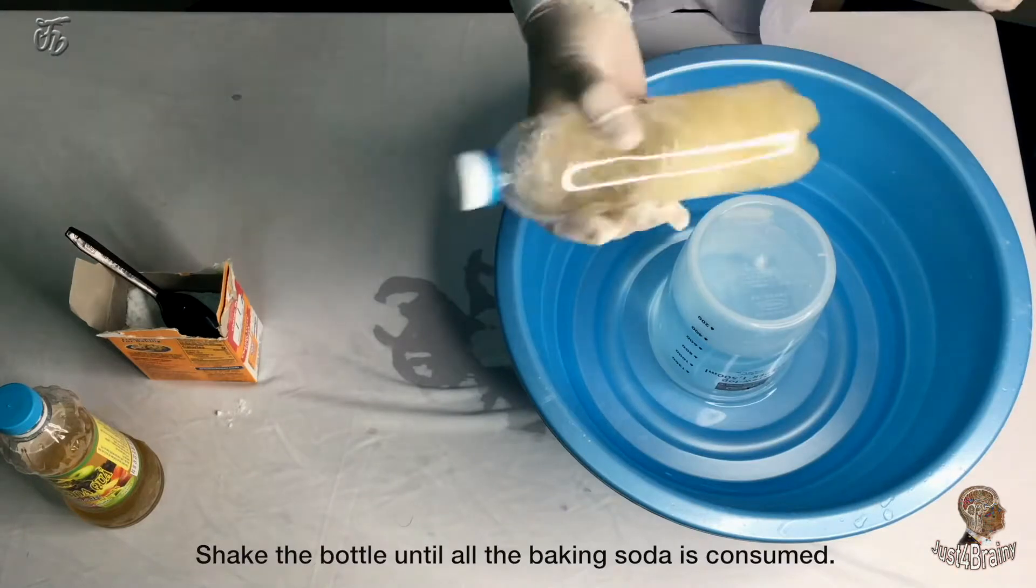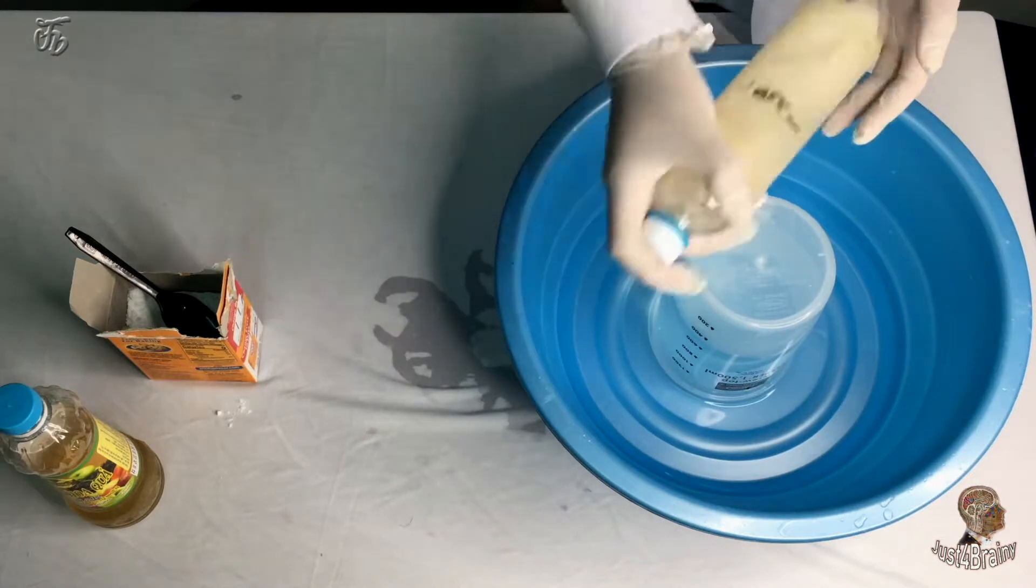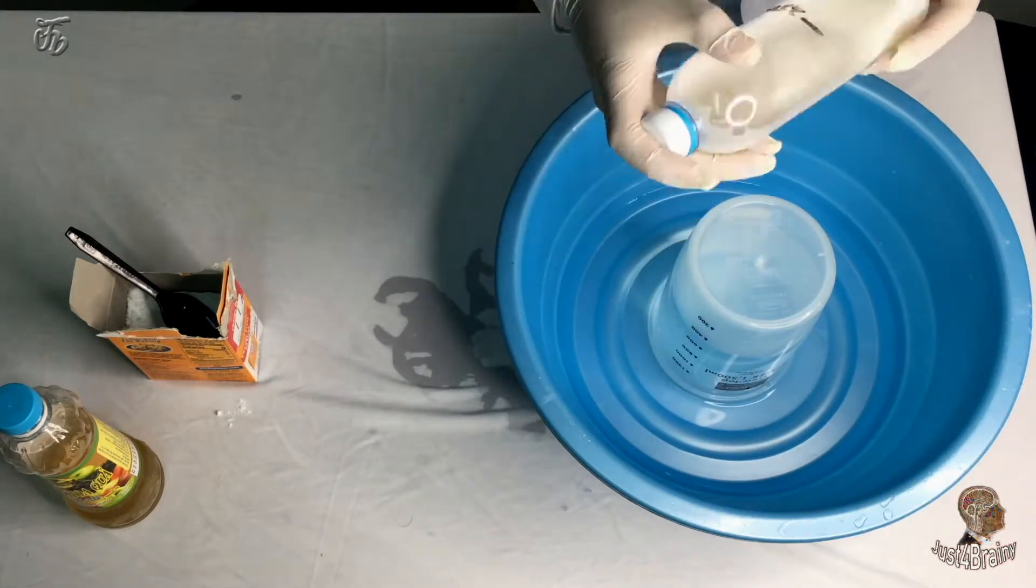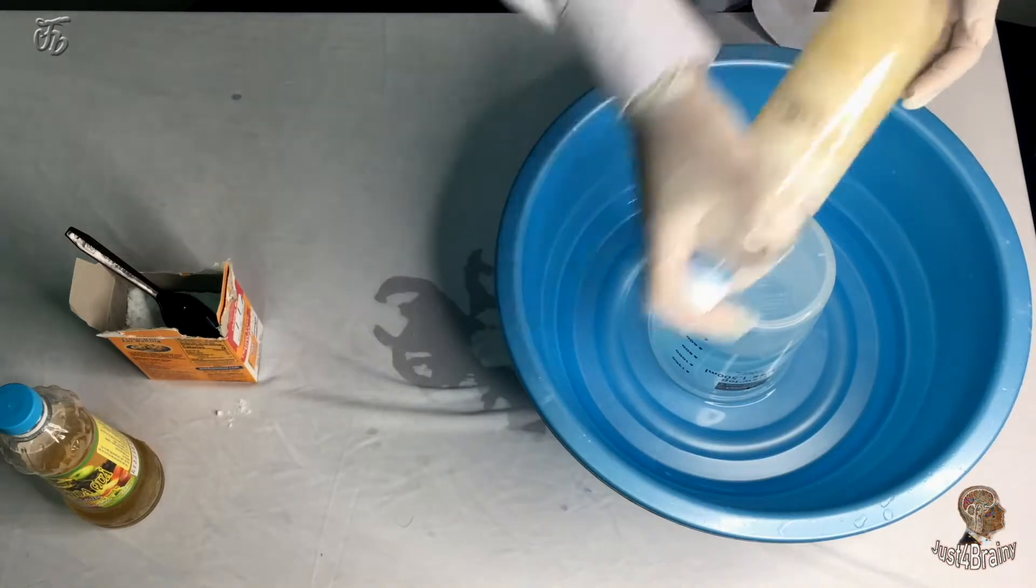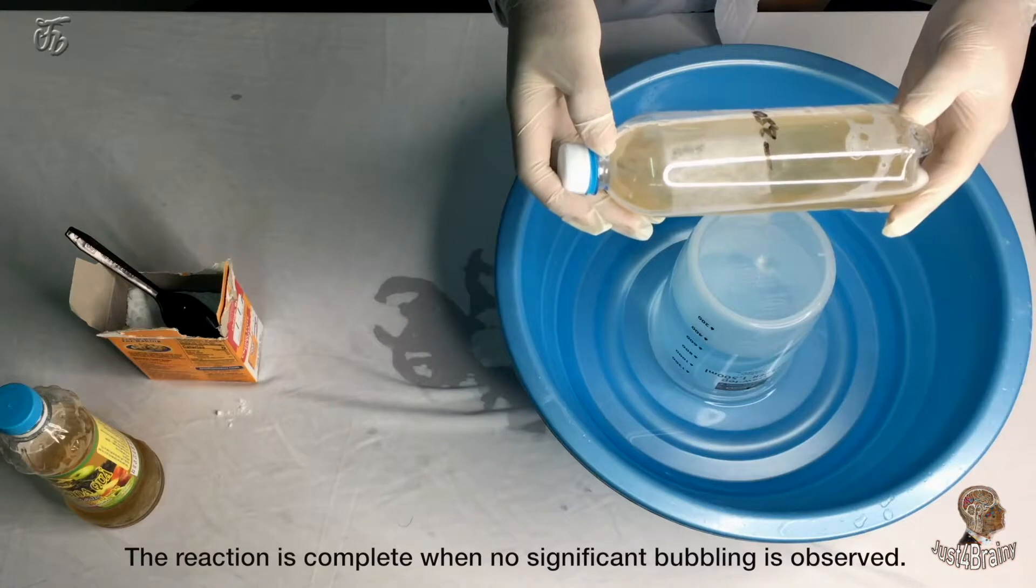Shake the bottle until all the baking soda is consumed. The reaction is complete when no significant bubbling is observed.